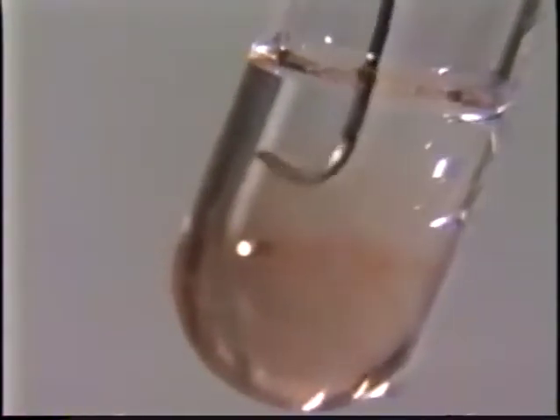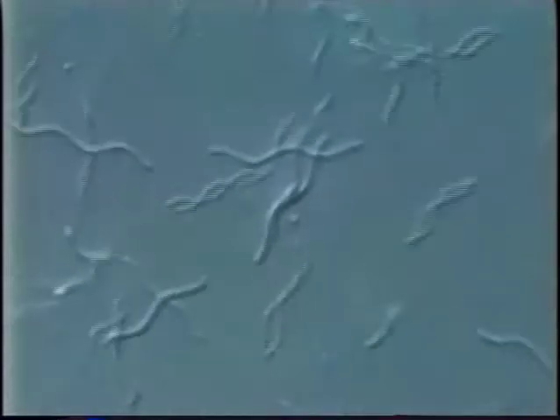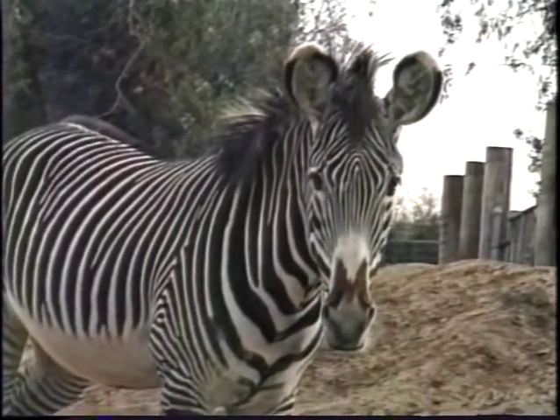This viscous material is made up of one of life's most famous molecules, DNA, the master molecule that provides the operating instructions for assembling a cell's proteins and other gene products. All life, from bacteria to mammals, develops and operates from a DNA blueprint.